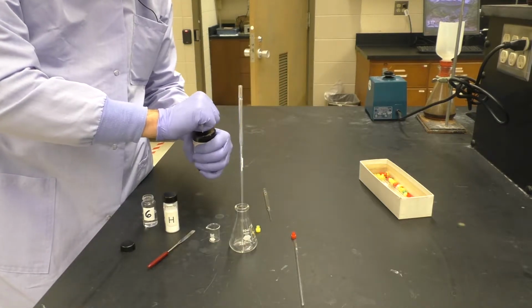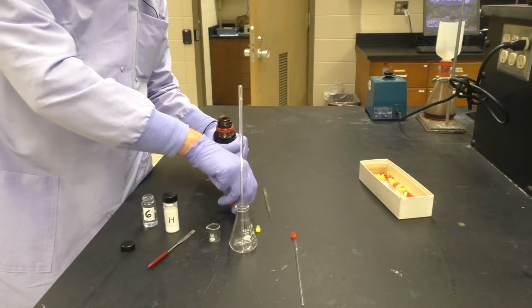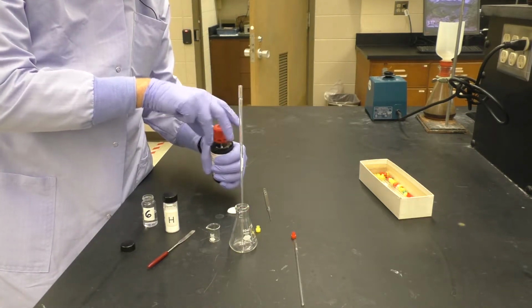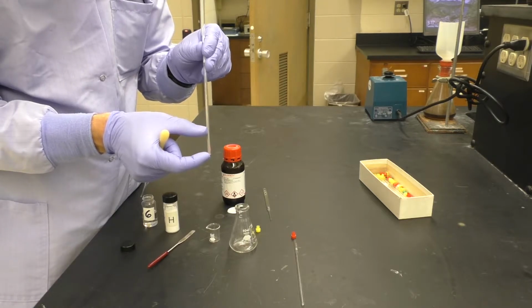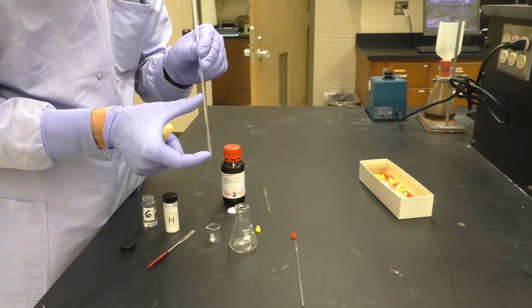And then taking your pipette and the pipette bulb and the NMR solvent, we can now add NMR solvent in. Now, before I do, there is a certain amount of NMR solvent that we wish to add. So we want to have about this much NMR sample solution in the tube. We don't want to have too much because that's wasteful.